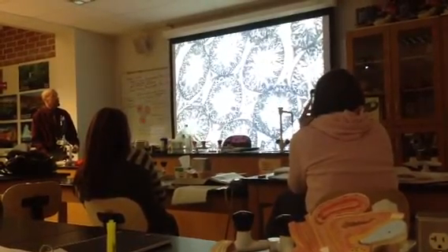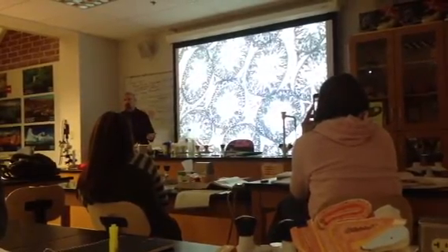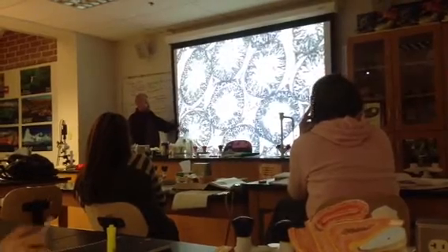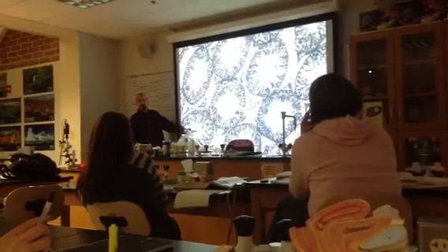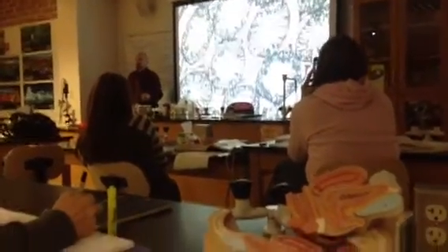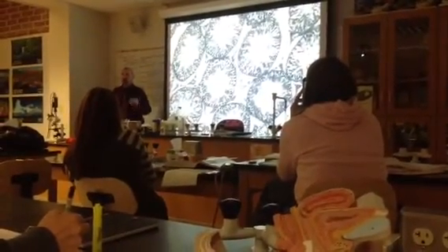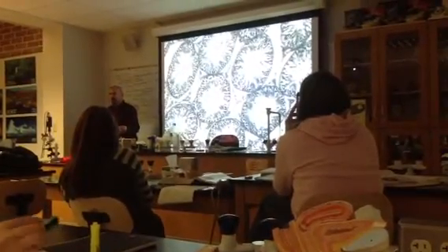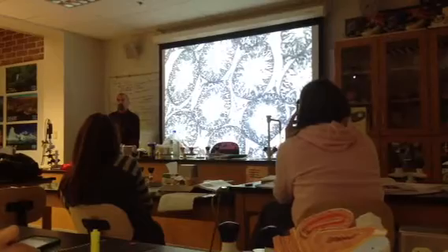So every seminiferous tubule is a series of developing sperm cells, okay? And the most primitive cells are on the outside. These are actually sperm that have just been released into the lumen of a seminiferous tubule. Then the seminiferous tubules are going to lead to a bunch of other named tubules. Eventually those tubules will lead to the epididymis, which will eventually lead to the vas deferens, etc. All these different tubes eventually lead to the urethra and out of the body.